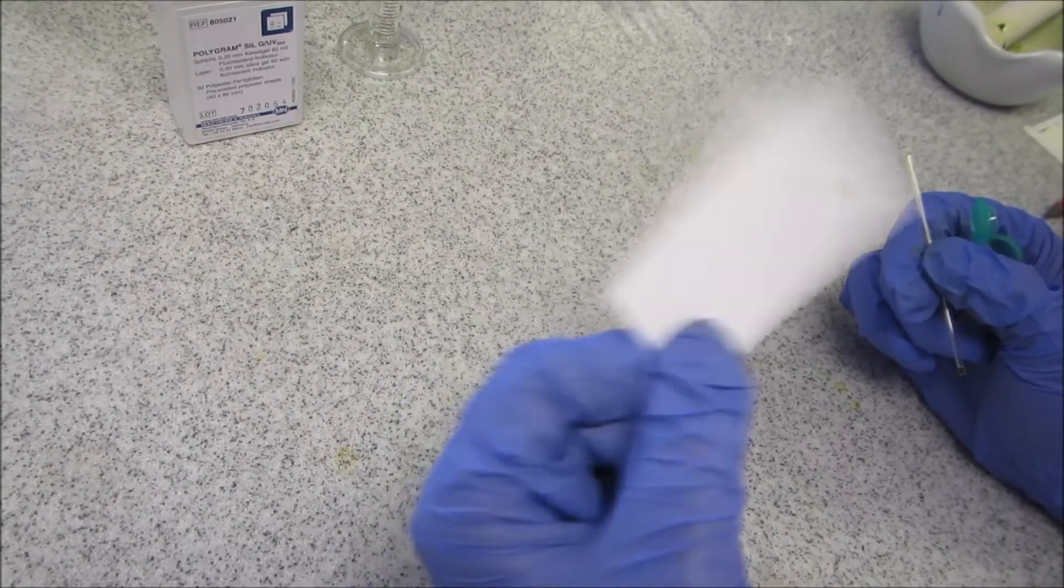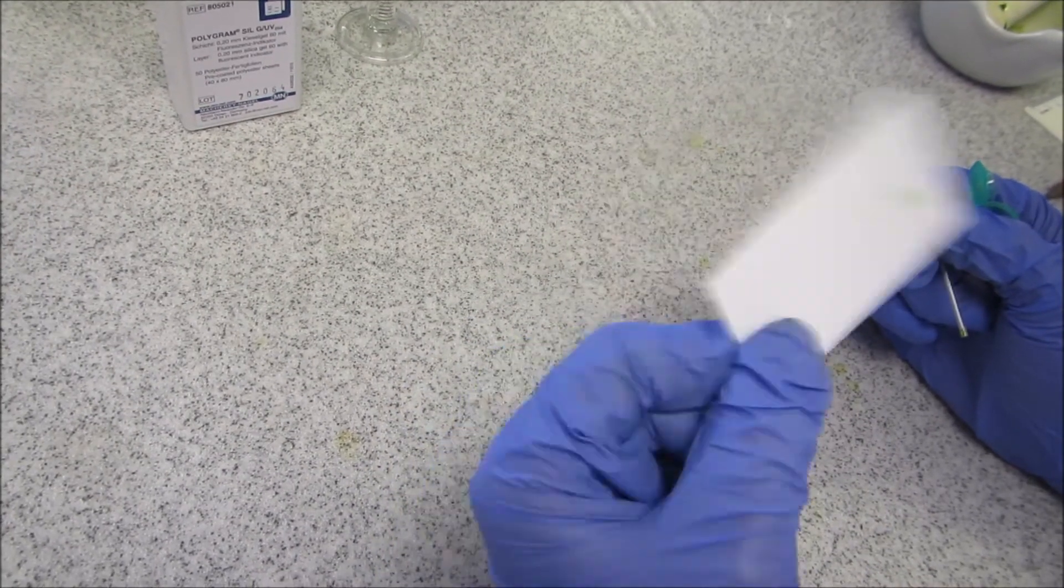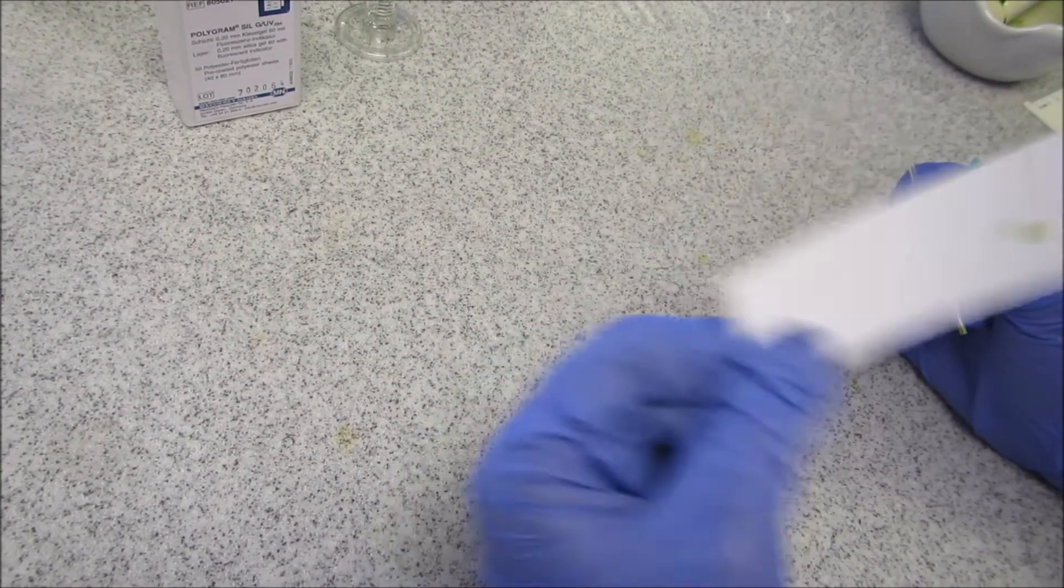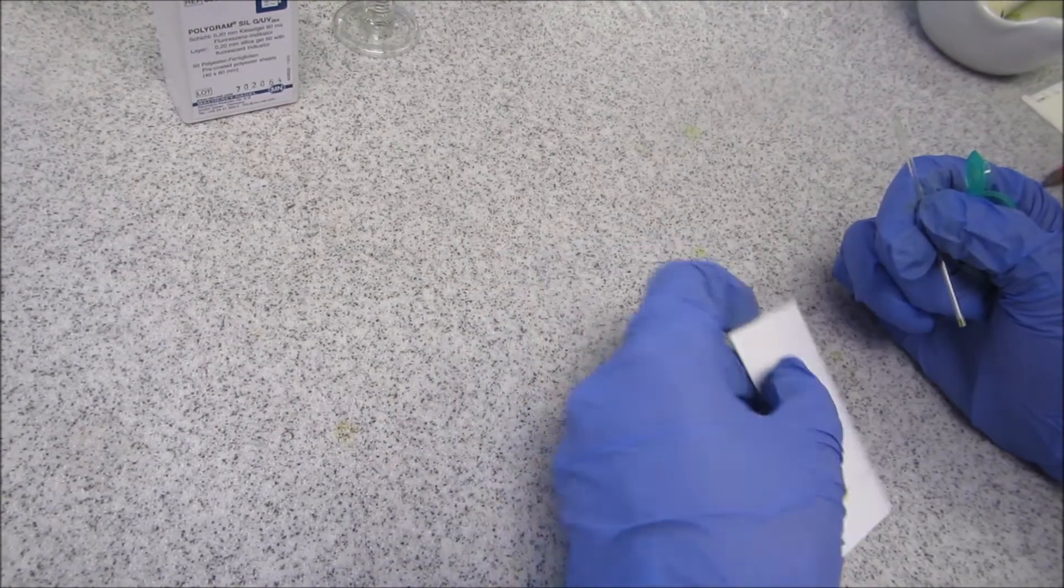I just dry it by moving. So you're going to want to repeat this and so you have about five dots in the same place, and make sure they dry between each one.